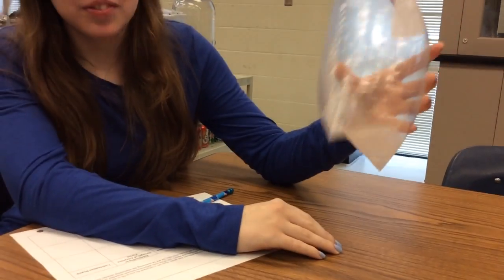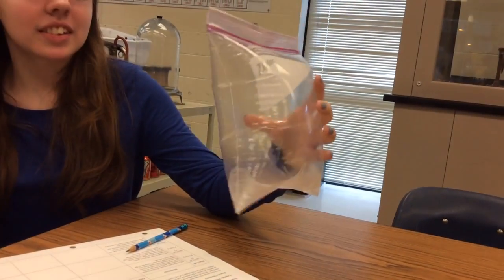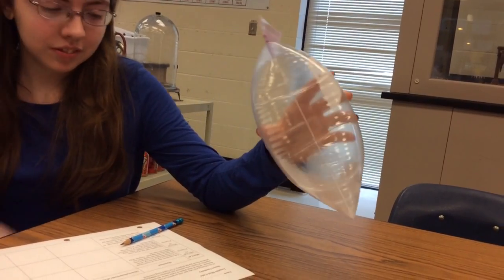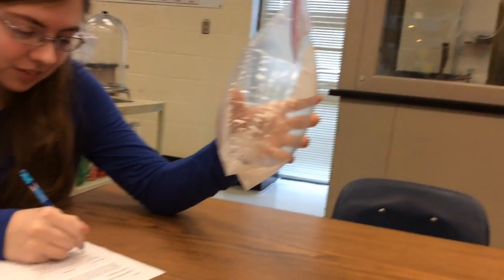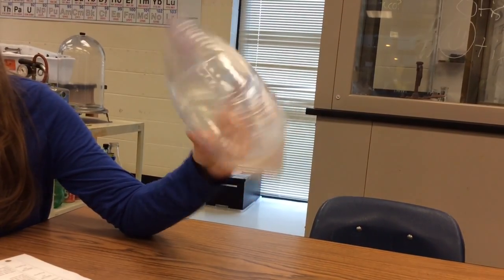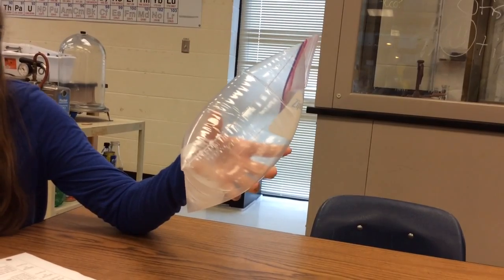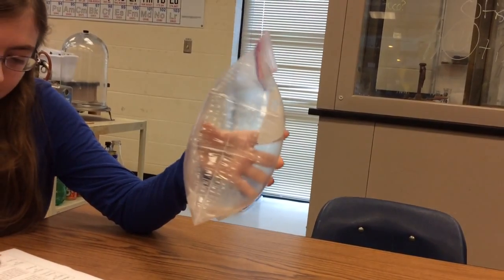So yes, indeed, we are illustrating that butane liquid is very, very volatile. Remind me again — what is the definition of volatility? Being able to evaporate quickly. Being able to evaporate quickly. You got it.